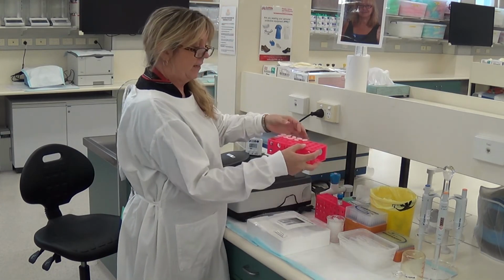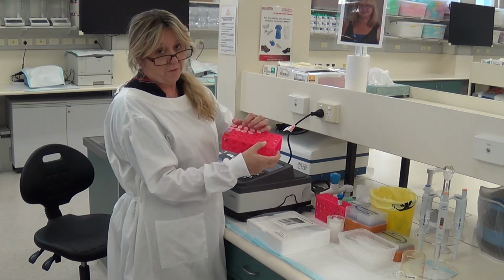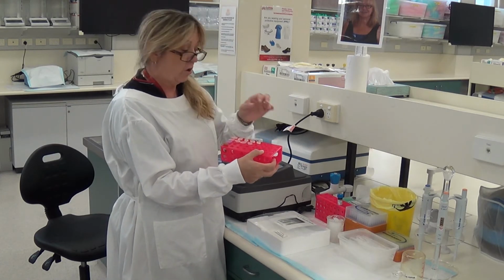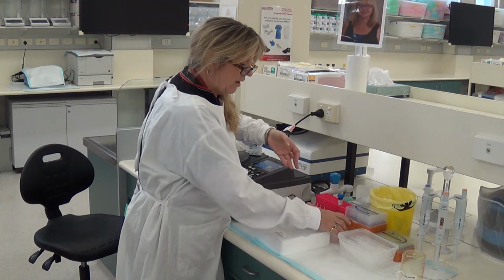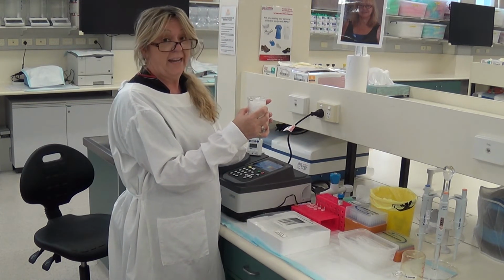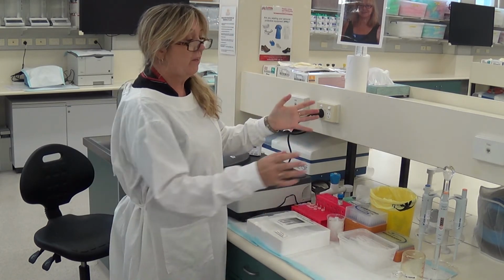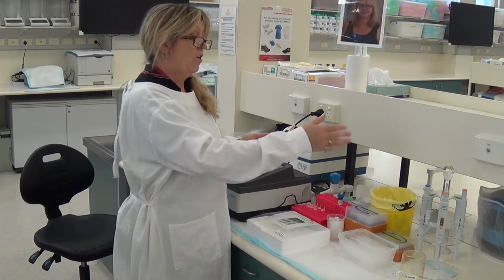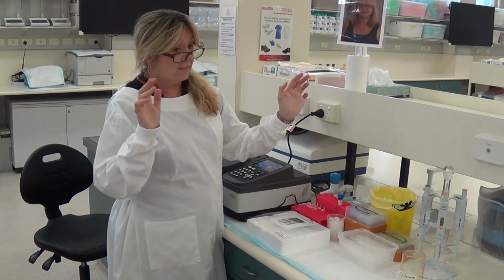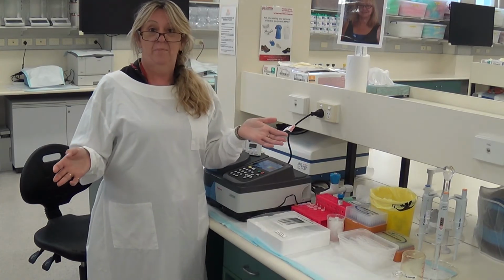We have the rack here that has all our alcohol concentrations in it. So we have 5 concentrations of ethanol, 4 concentrations of propanol, and then we have 1 of methanol and 1 of isopropanol. We have our enzyme, which is our alcohol dehydrogenase, otherwise called ADH. It's on ice, so that way we can make sure it works when we need it to. And then we have the usual stuff that goes on it. So we've got our pipettes and our pipette tips, which you should be familiar with since you did your pipette exam. And that's it. So we'll move on now and we'll start the lab.